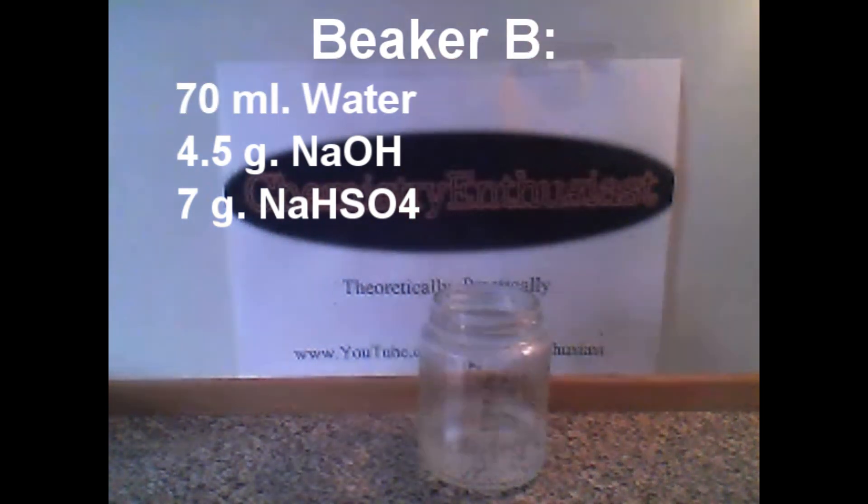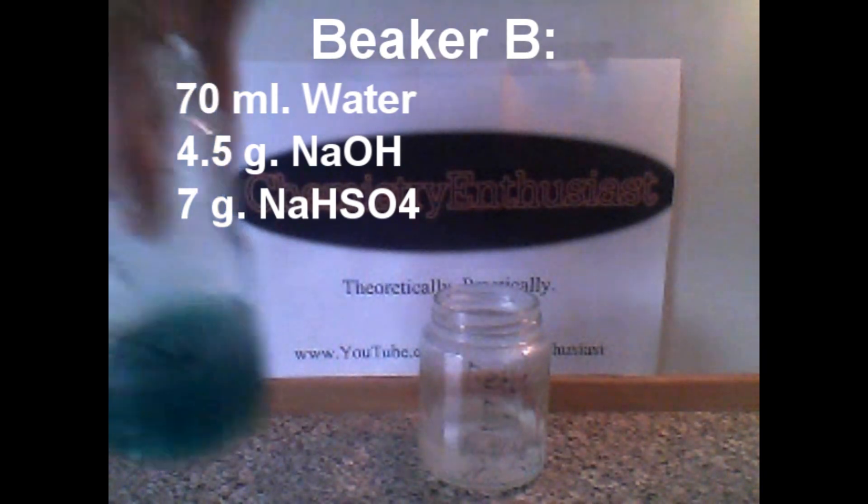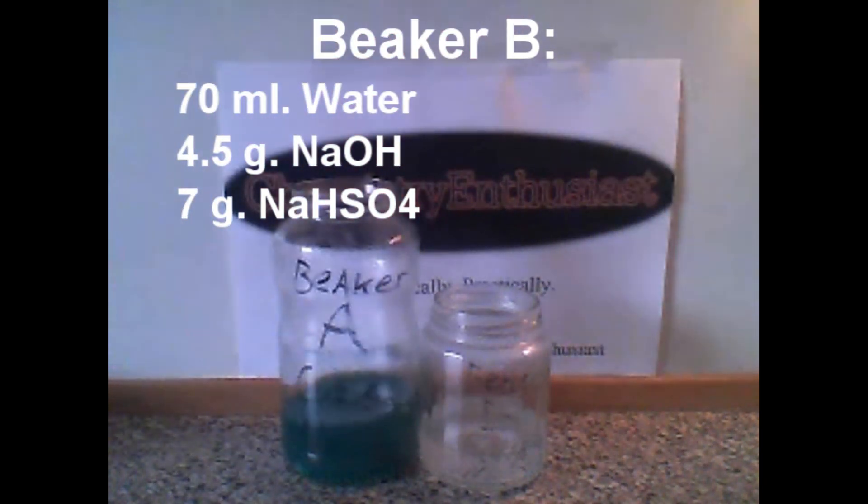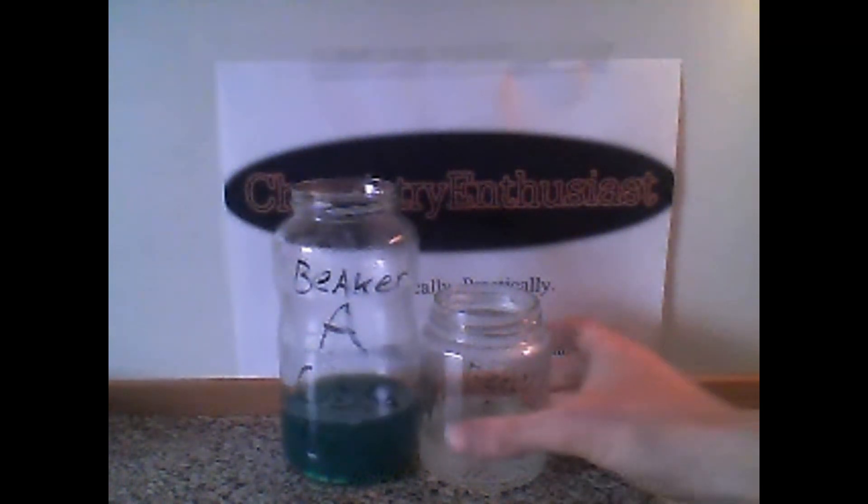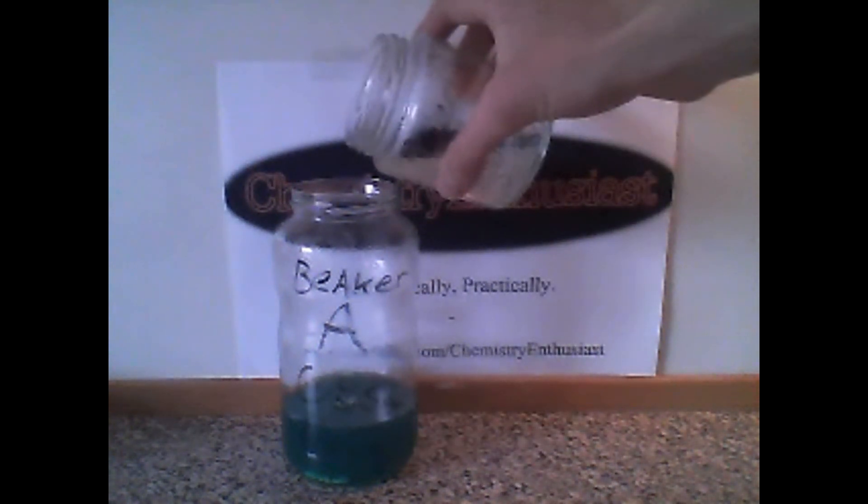Now that's it, far more quickly than the copper sulfate and sodium chloride. Now take beaker A back to the table again, and then pour in beaker B.